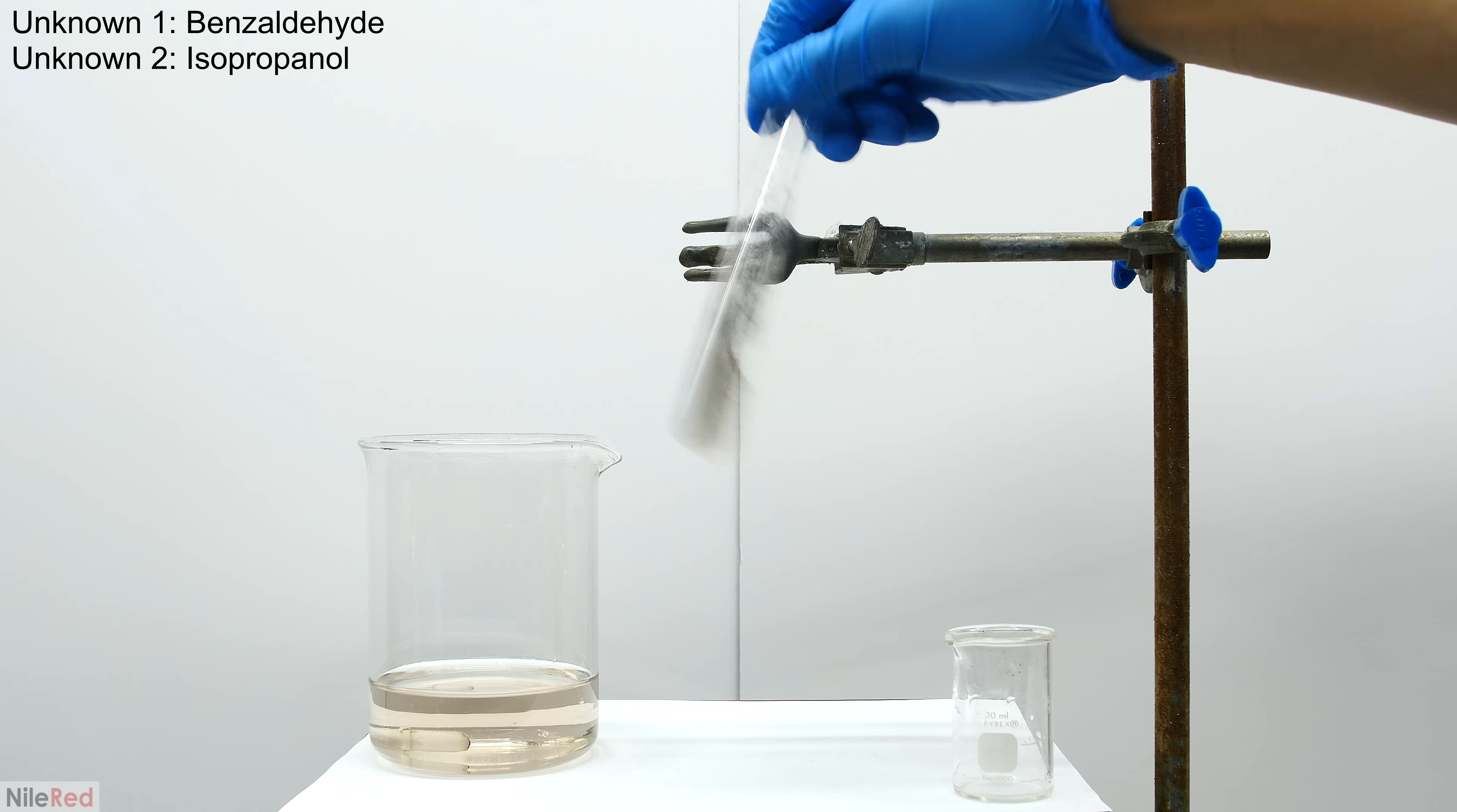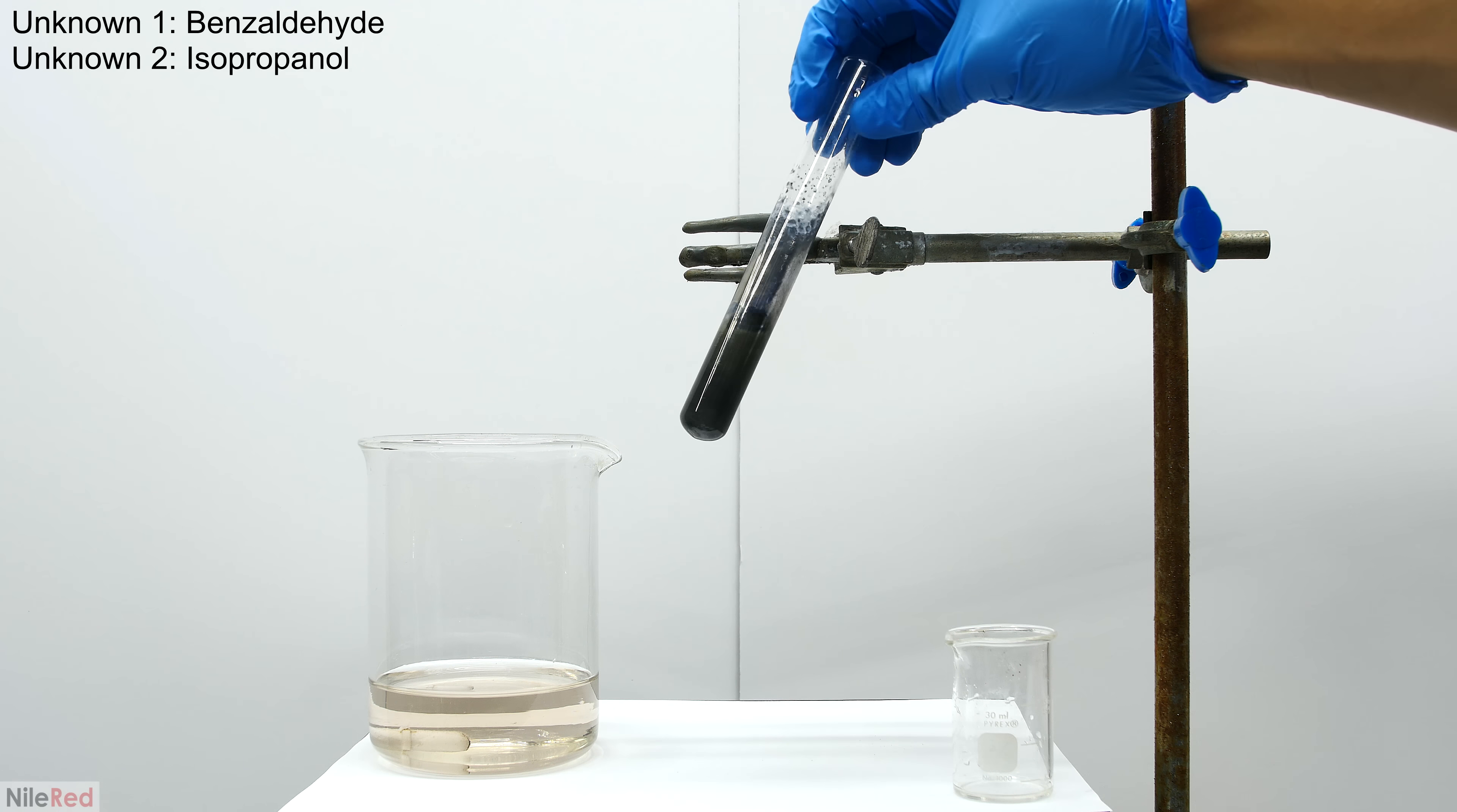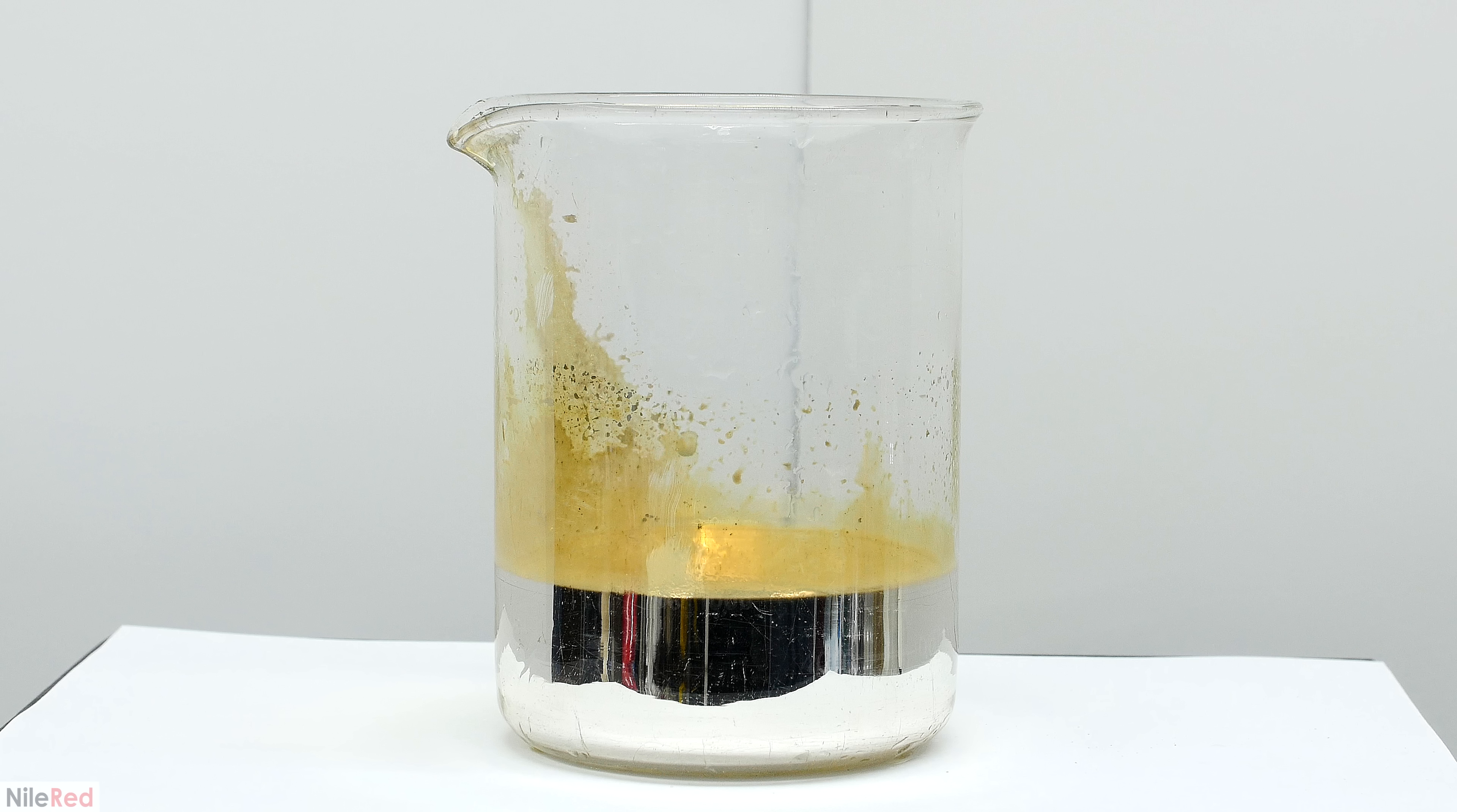Just for fun, I pour the remains of the other unknown in, and we very quickly get a positive result. That's about it for the Tollens reagent.